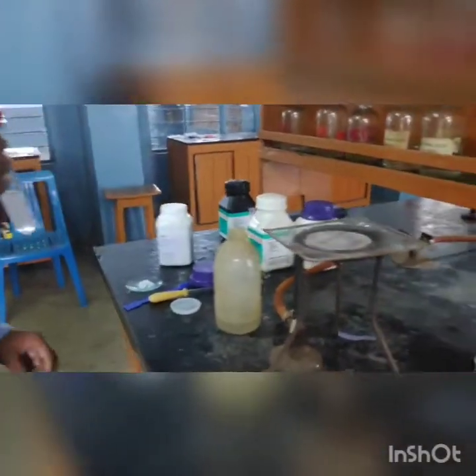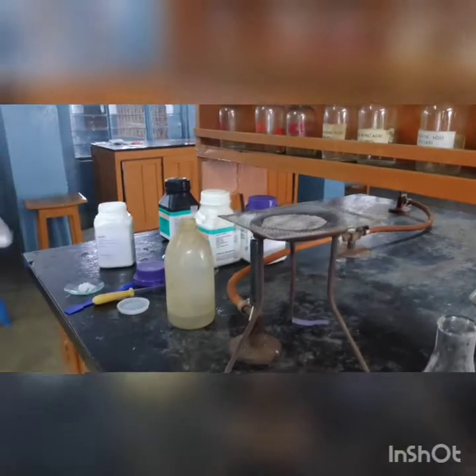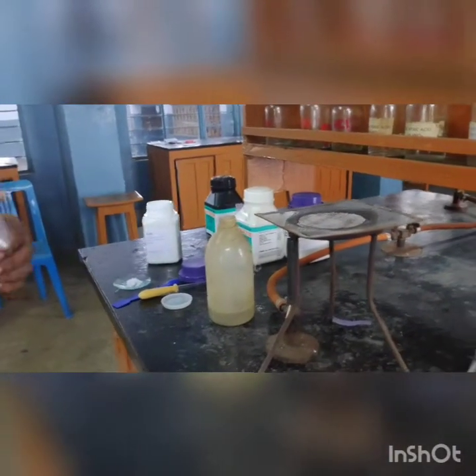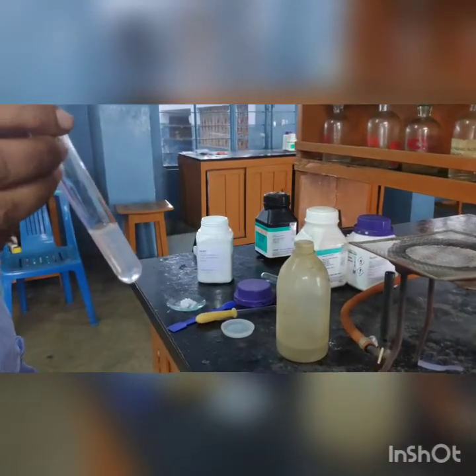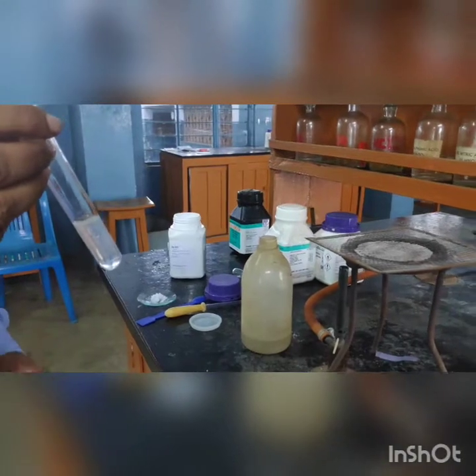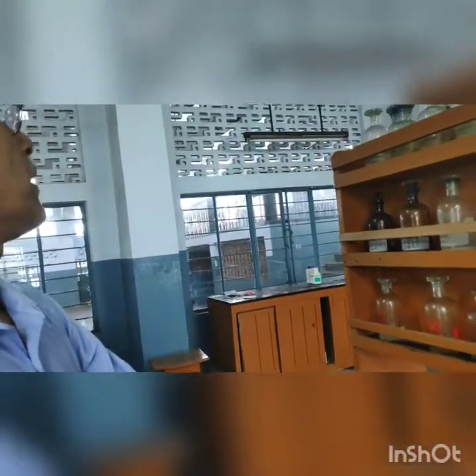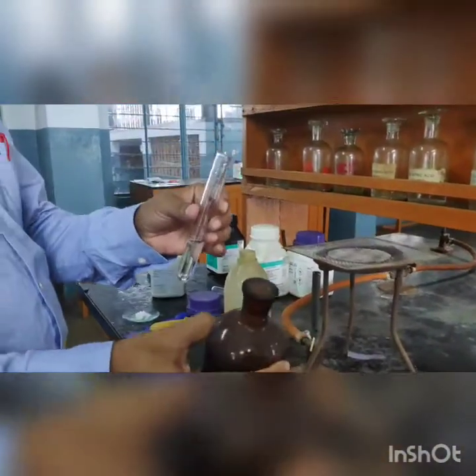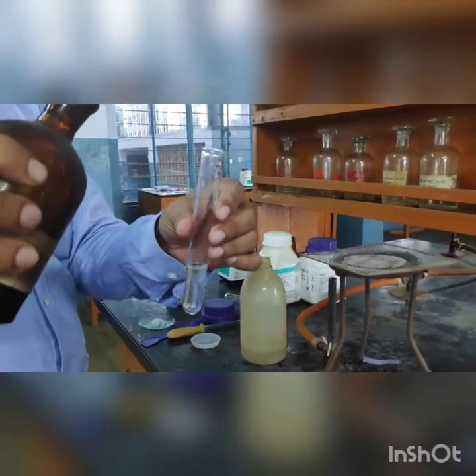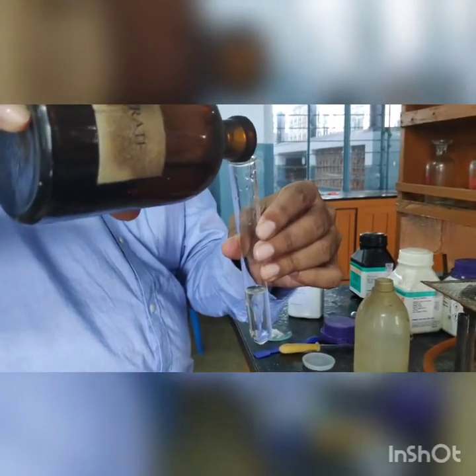This is another part of filtrate from a sodium carbonate extract prepared for a different salt, and in this case we are going to test for the chloride ion. The reagent is silver nitrate (AgNO3) solution, always available on the bench. Remember, this is the acidified sodium carbonate filtrate to which AgNO3 is being added.